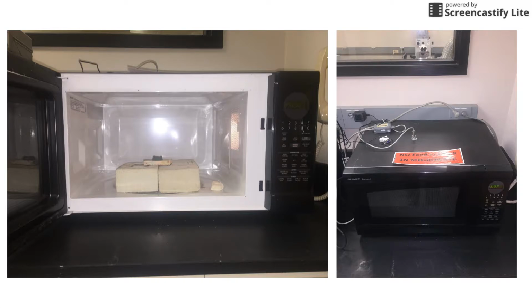Typically, the encapsulation process is conducted at very high temperatures and requires a significant amount of energy. Using microwave annealing allows this process to be carried out faster at lower temperatures and thus with a lower consumption of energy. The microwave used in this process was a standard kitchen microwave with the addition of a sensor to measure the temperature of the sample. Ceramic blocks were placed in the center of the microwave in order to raise the sample and therefore directly align the microwaves with the sample.